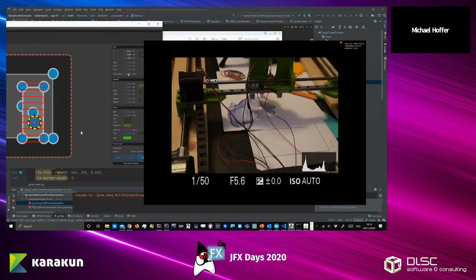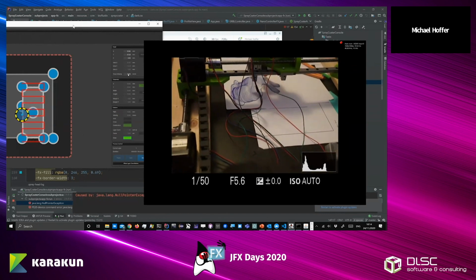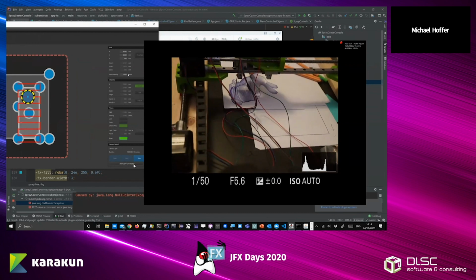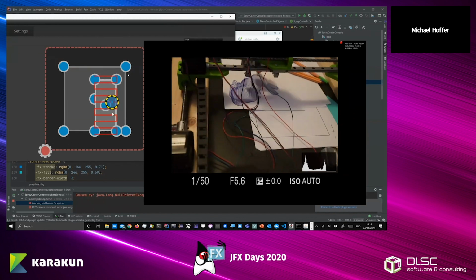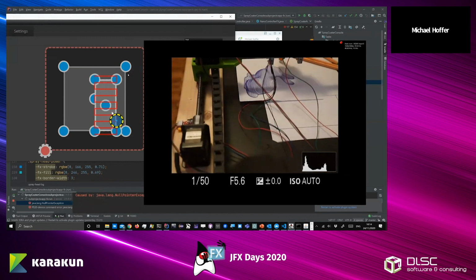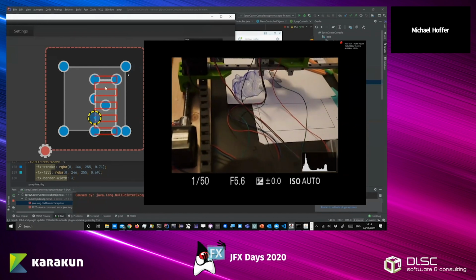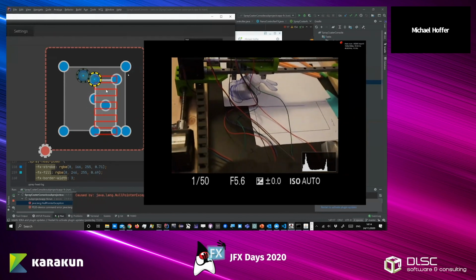And for me and for the whole team, it was really nice to use the scene graph. As much as I've criticized the scene graph in the past, as much I have to really give a shout out to it, because for what we wanted to do, it was really, really great, because this is just basic geometry. I don't know if you heard about G-code, but this is like sending the coordinates to the machine. And this G-code visualization in JavaFX is so easy to accomplish.